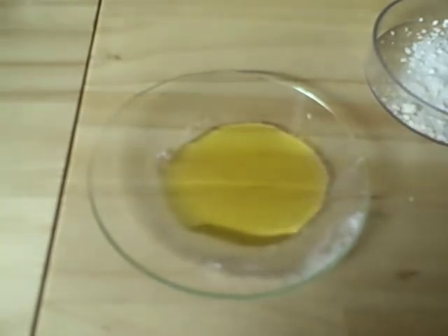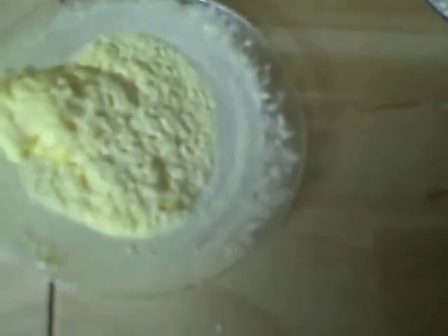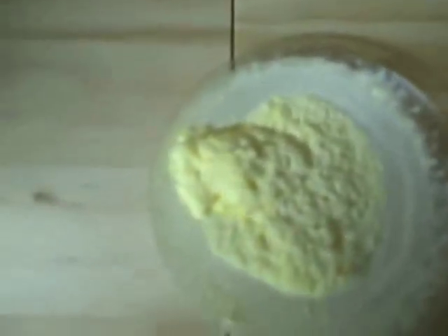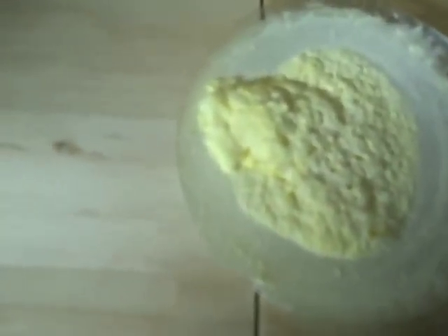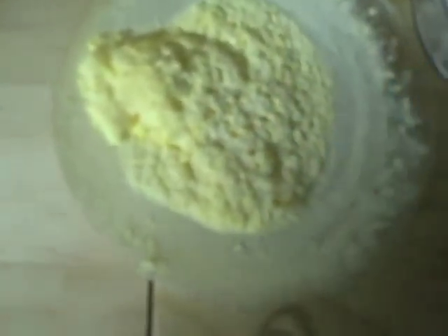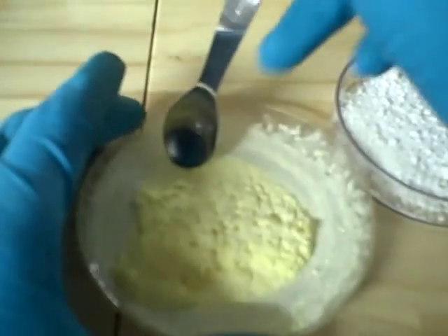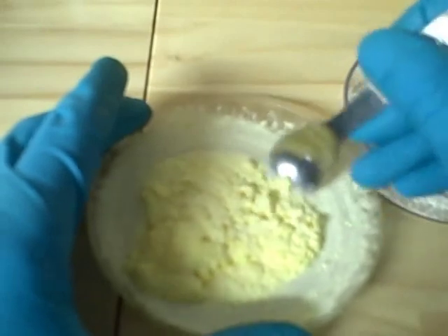Here's what you're looking at — this came right out of the microwave. The crystals can be lighter or darker, it all depends on certain ratios. This is what it usually looks like: a kind of whitish crystal. However, for some reason this time it came out sort of yellowish. Next, all you need to do is take a small spatula and you can grind it up.